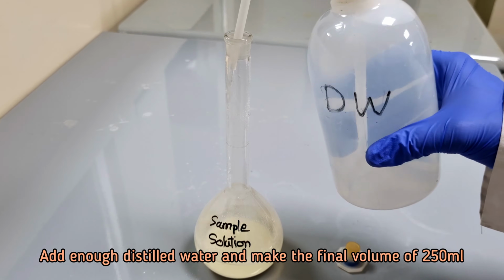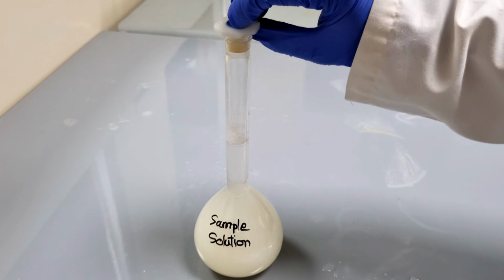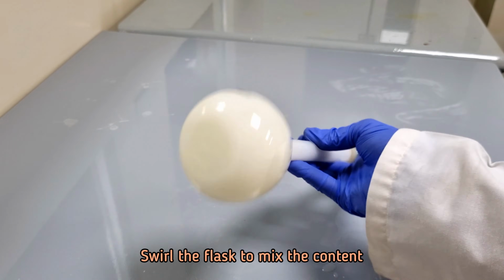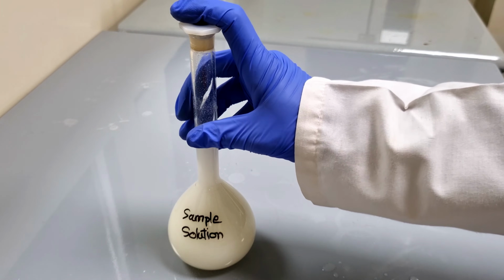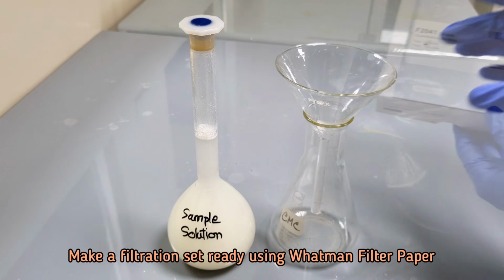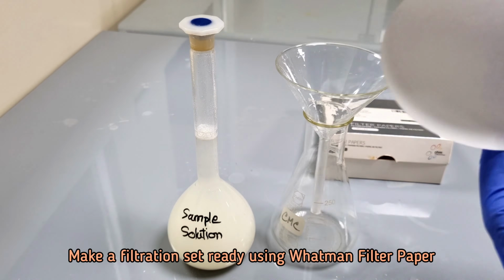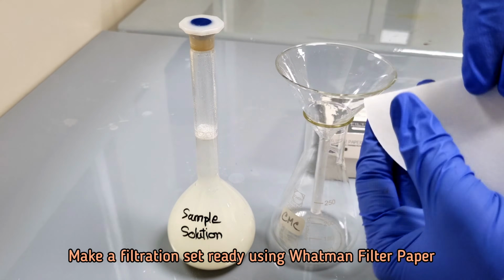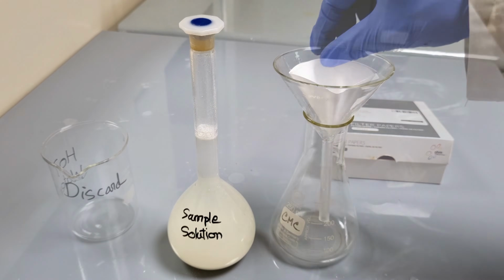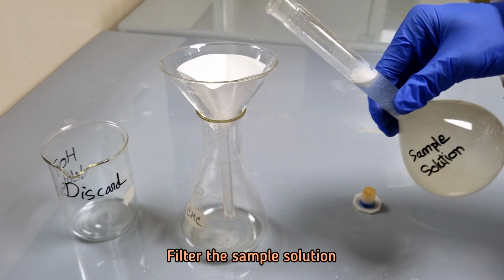Add enough distilled water and make the final volume of 250 ml. Filter the sample solution using Whatman filter paper.